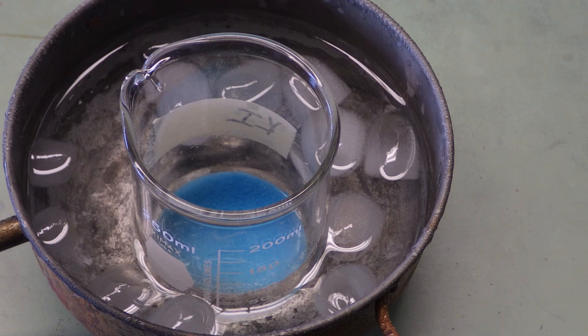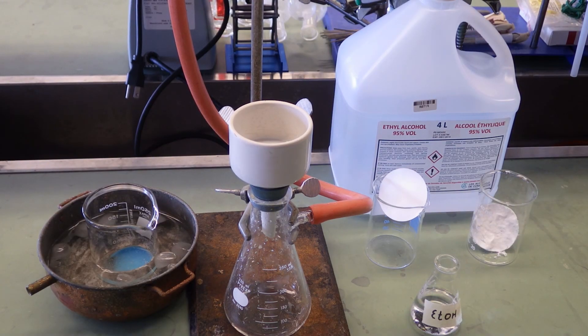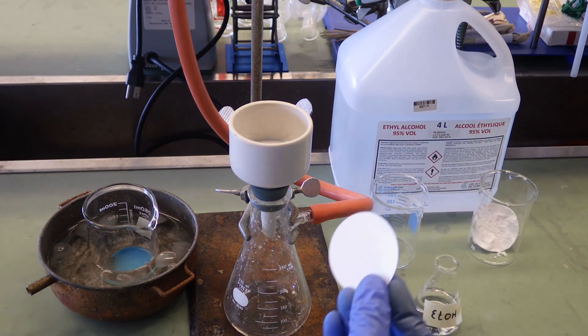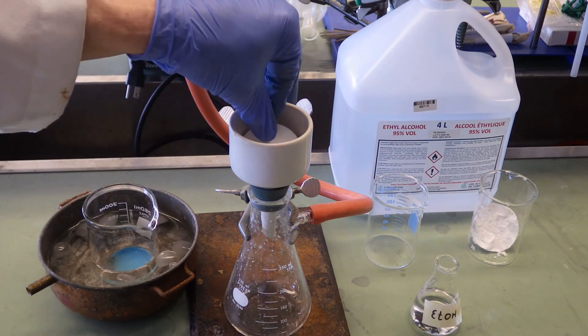Here it's been sitting in the ice bath for 10 minutes, and now our final step is vacuum filtration. Here's our pre-weighed filter paper. Make sure it seats properly flat.